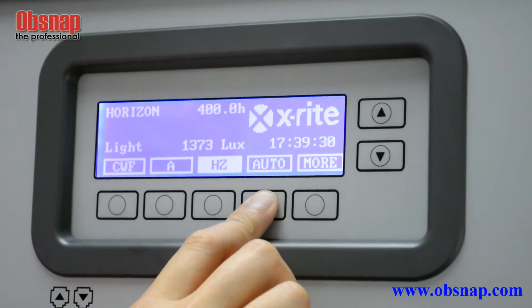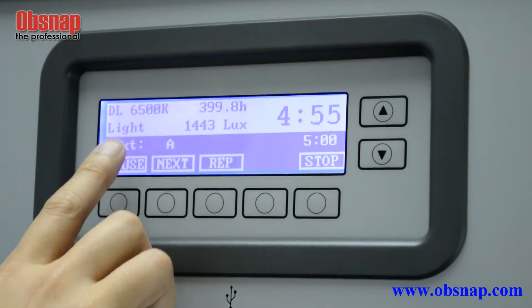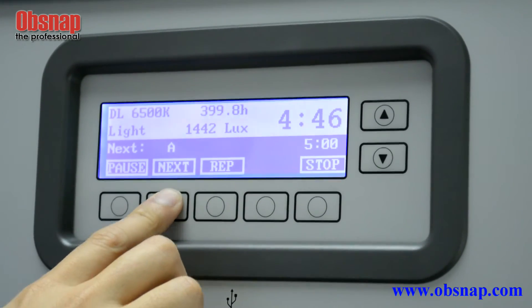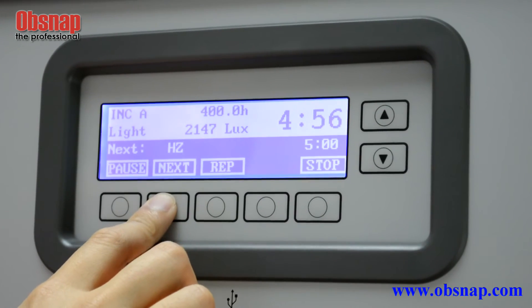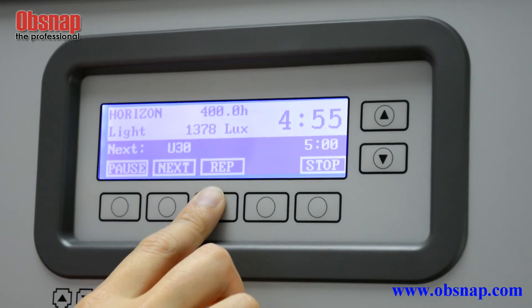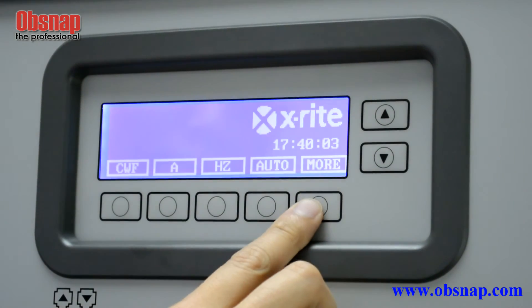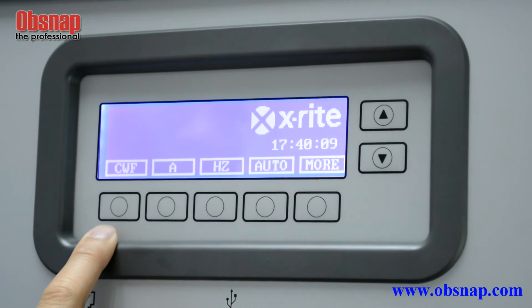We can also set a program to run for 5 minutes at each light source. We can pause it — the timer will pause. Or we can skip to the next light source, again with 5 minutes. We can also set it to repeat, running only 5 minutes at each light source. And we can stop the program to return to the main menu. This makes it very convenient to cycle through different light sources.